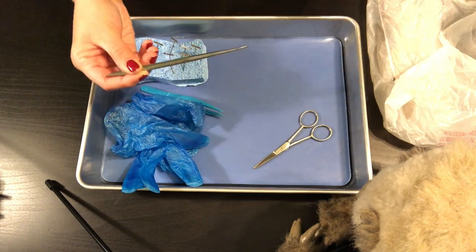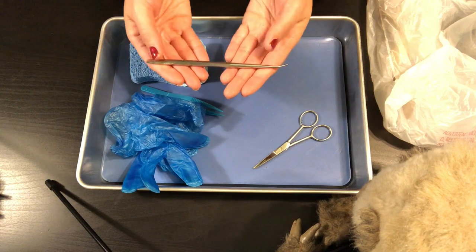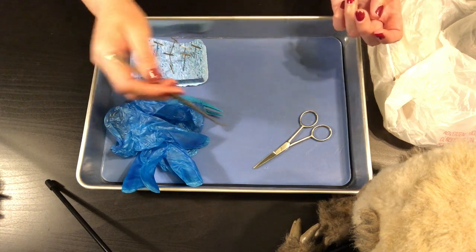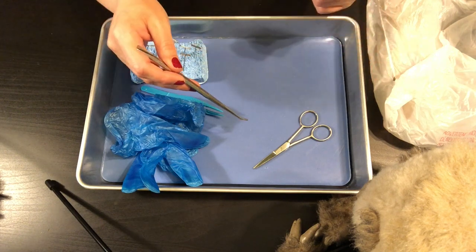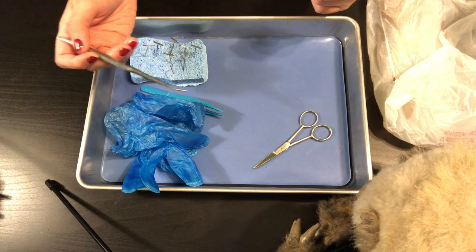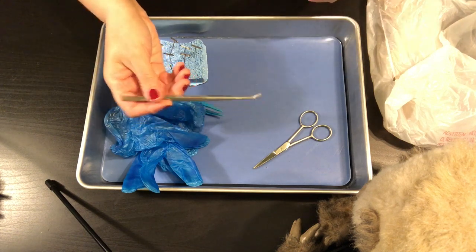I have a probe, and you won't have this in your dissecting kit, but I use it because it helps me point at things when I need to be a little more precise than just my finger. I'll walk around class when we dissect and help you identify things with this probe.